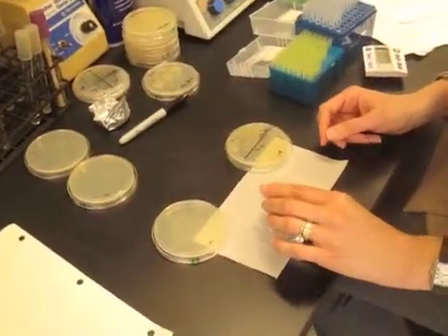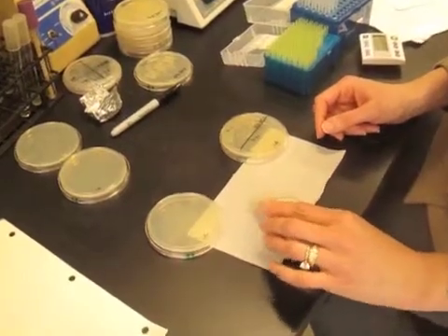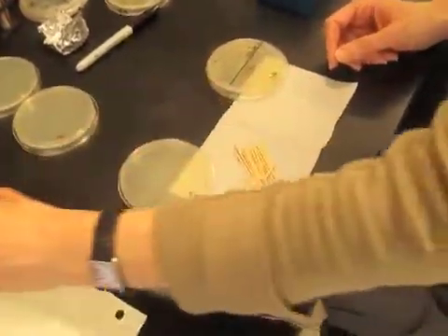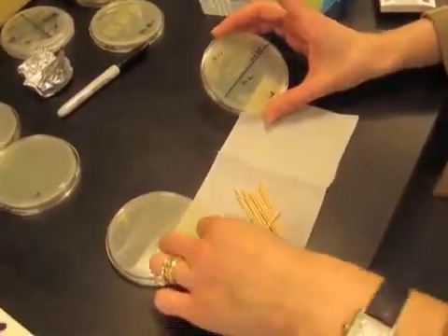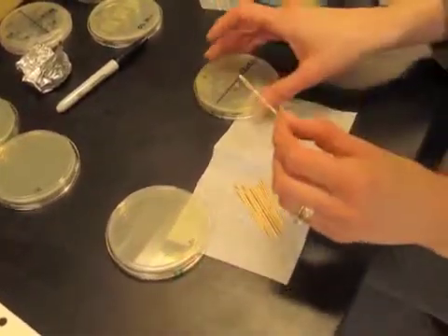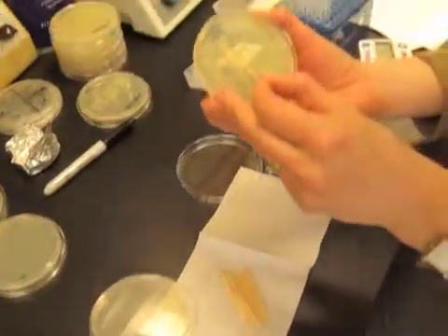This is the technique that I use for patching the cells to do the transformation lab once they've grown on a petri dish as single colonies. I take a sterile toothpick and pick up a colony.